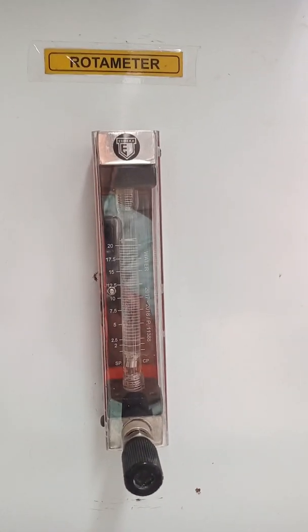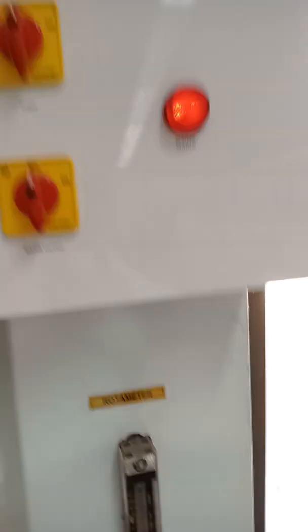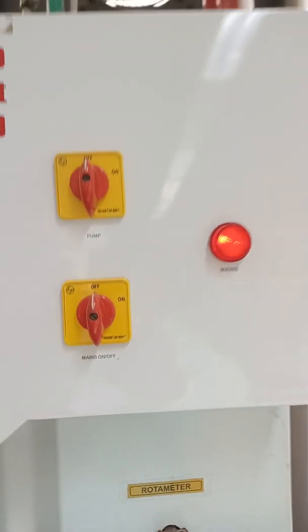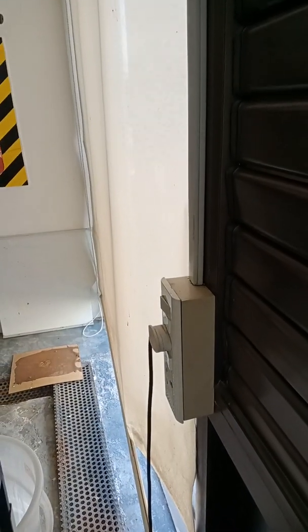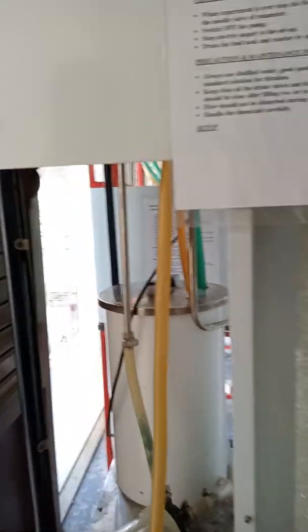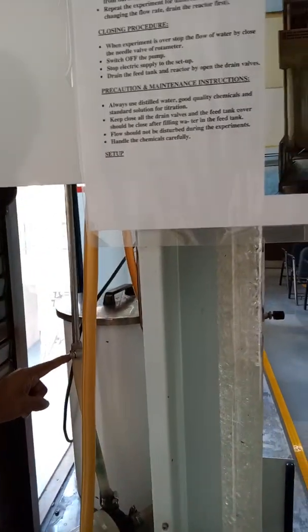At the bottom of the rotameter you see the needle valve where you can control the flow rate of water to the reactor. These are the mains: the one at the top is the pump switch, and the second one at the bottom is for the overall system. It is connected to the electric supply at the back, so you have to turn on the electric supply first, then turn the mains on, and subsequently you can operate the pump using the switch at the top. Initially you have to fill the feed tank at the bottom — 25-liter capacity — and then turn on the magnetic pump.